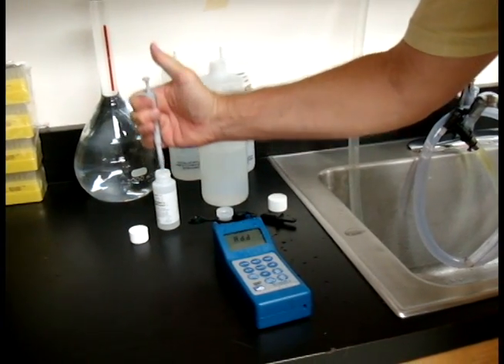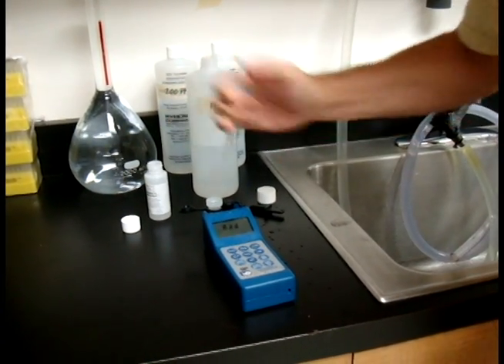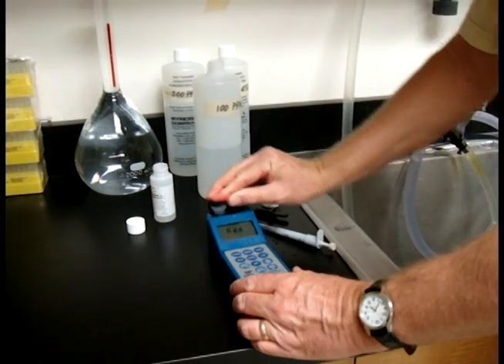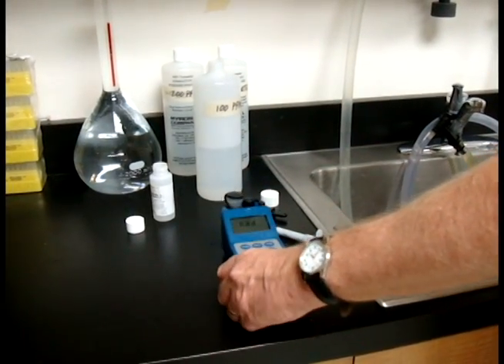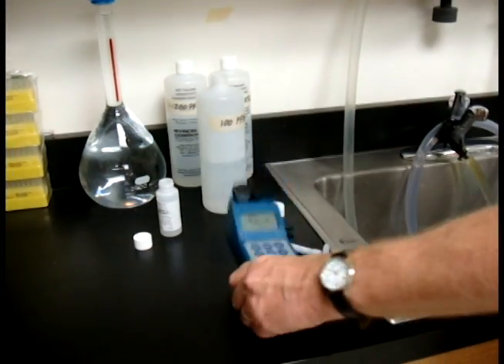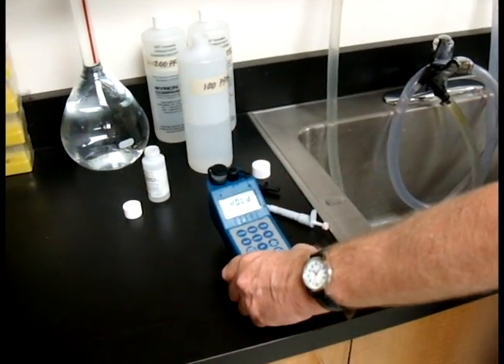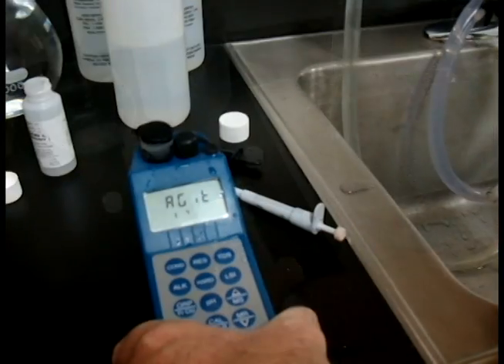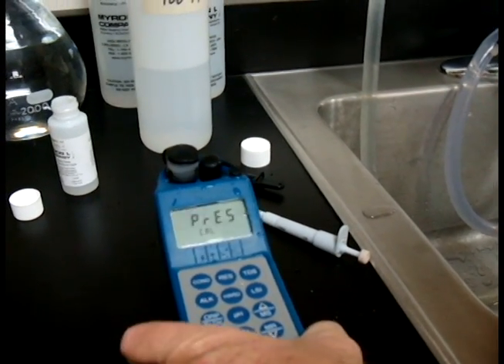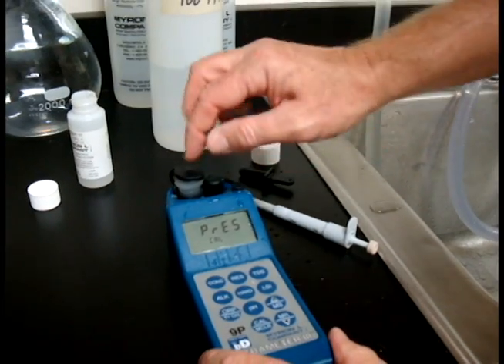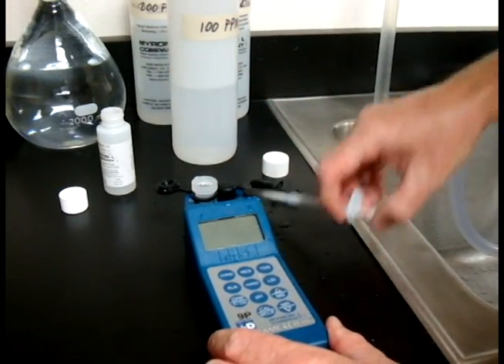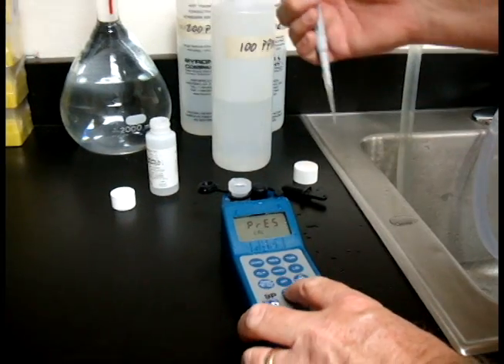Add A1. And again, begin to agitate. We're on T4 now, as you can tell. Hold. All right, take that cap off first. Hit CAL.